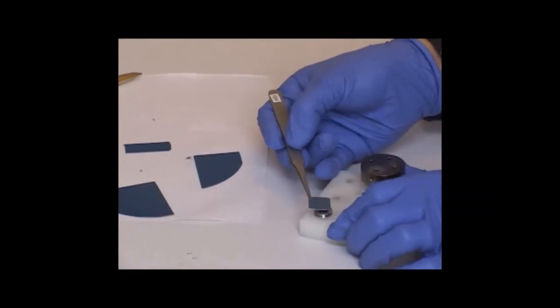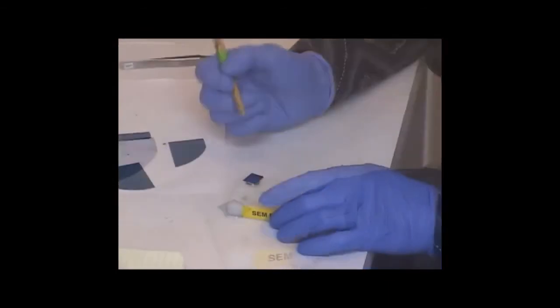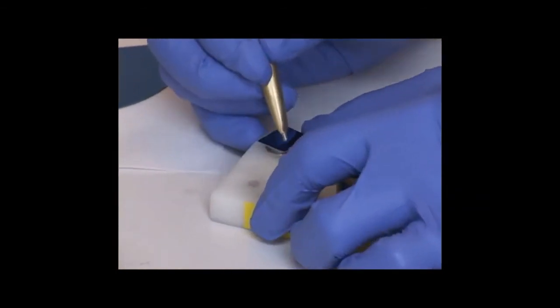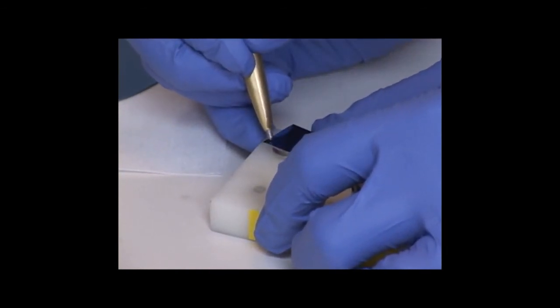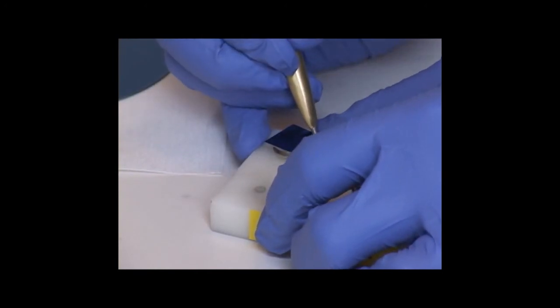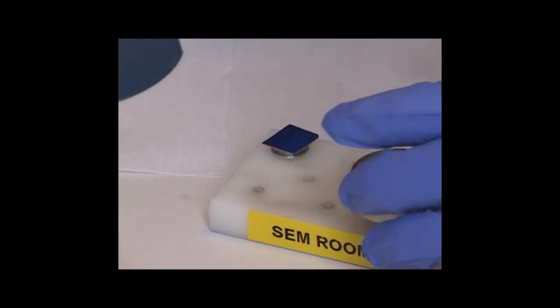The surface of this resist is featureless, so in order to have something to focus on so that I know that the resist is at the right height, I'm going to carve numbers into the corners on this chip. They don't need to be deep enough that they score the silicon, they just need to be through the resist layer. So I'm numbering the corners clockwise, 1 through 4. That'll give me a reference point when the chip is in the system.